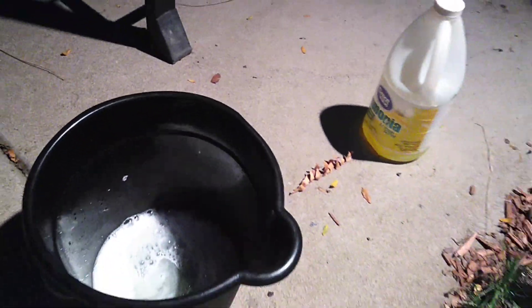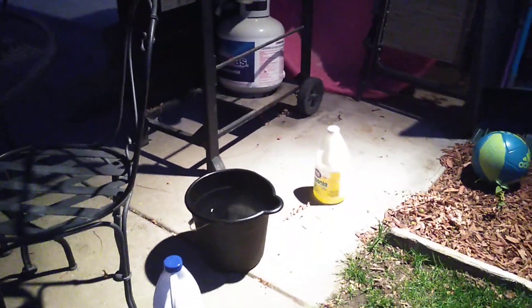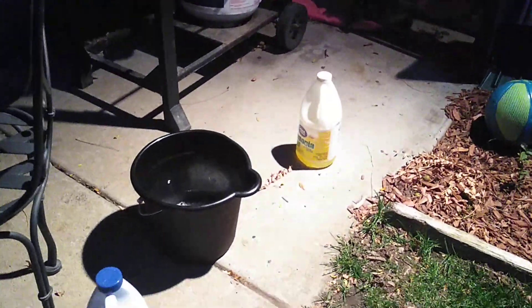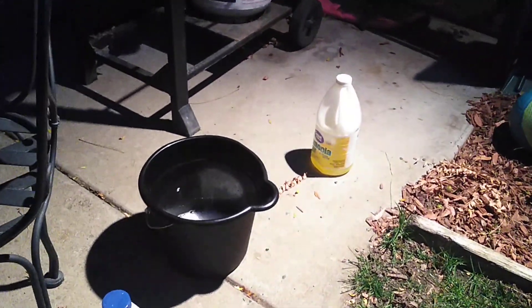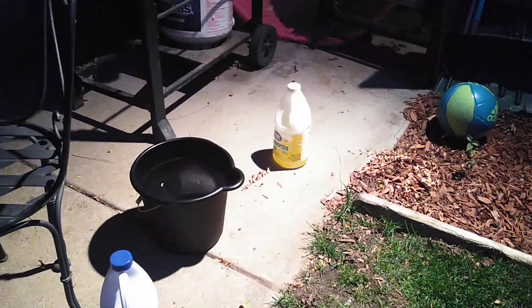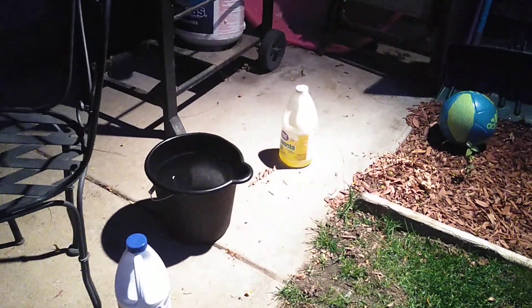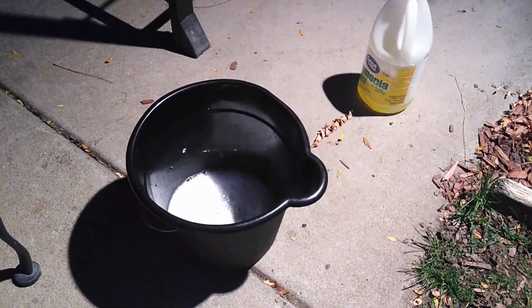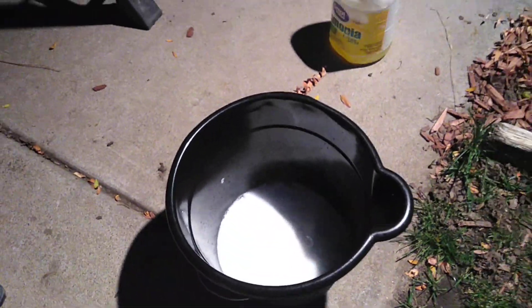What's happening? Nothing. Oh, that smells. Okay, that is bad. I'm backed up because I can see fumes coming off. It is reacting. I got the gloves. Let's see if there's any heat being produced. It's heating up a little bit.